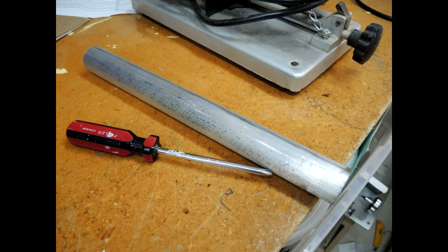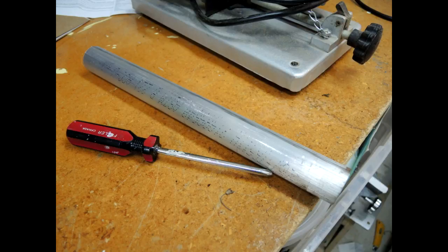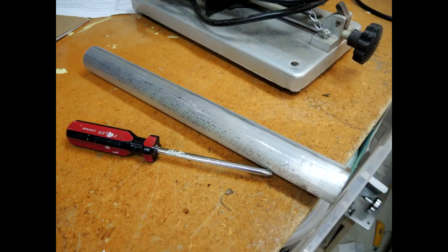Okay, mostly a voiceover video because I use metal to fabricate the part and that's a pretty noisy affair. I use metal because I need something thermally conductive. The LED that I'm using for the top side illumination will draw about three watts so I need to conduct that heat out to the atmosphere and metal is a good choice for that.